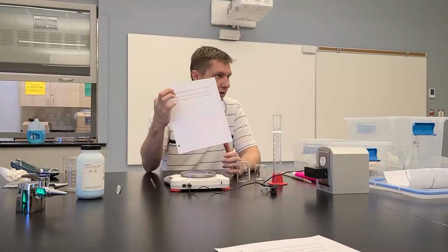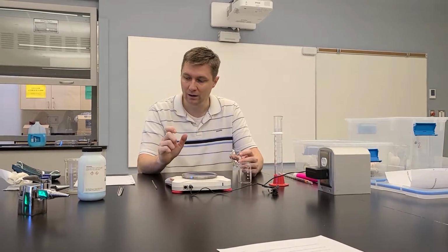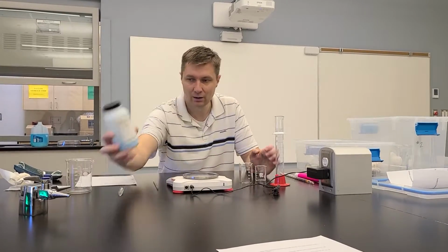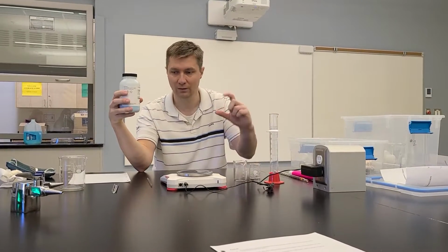Okay, so on your pre-lab exercise, you've got a calculation here that you need to perform. It says it wants you to make a stock solution, and we all know what a stock solution from class is: that's 20 mL in volume and has a concentration of 1 mole per liter. And it wants you to calculate how much mass of the copper(II) sulfate you need in order to make that solution with that concentration and with that volume.